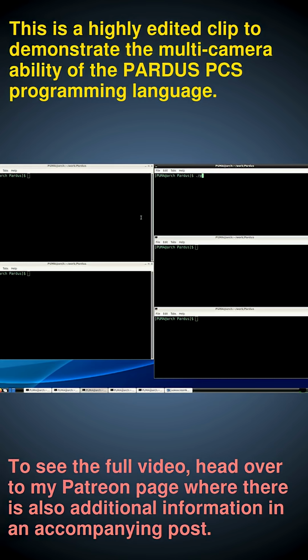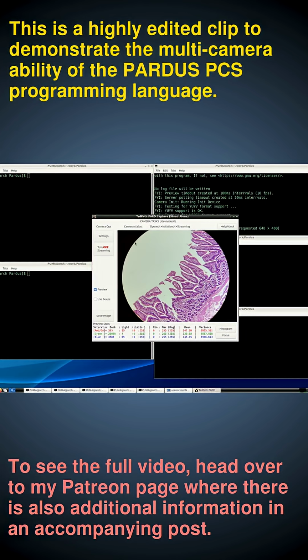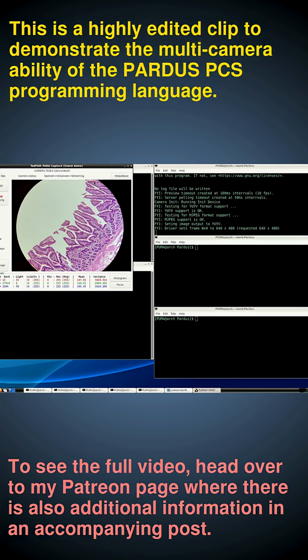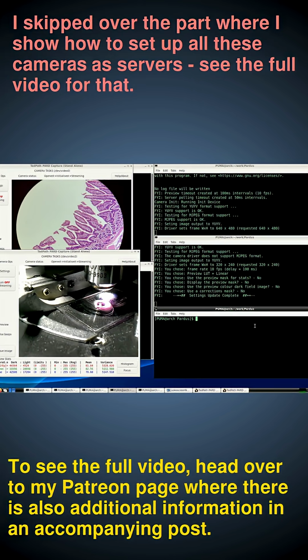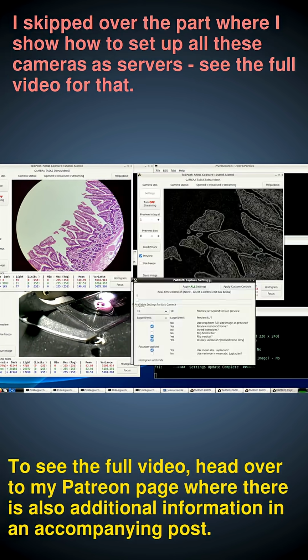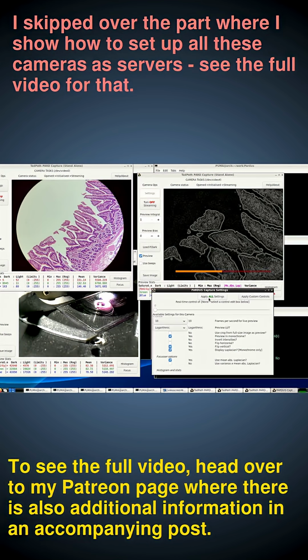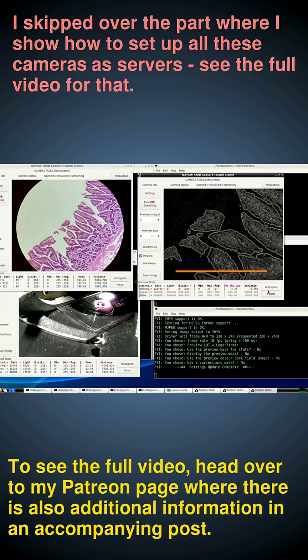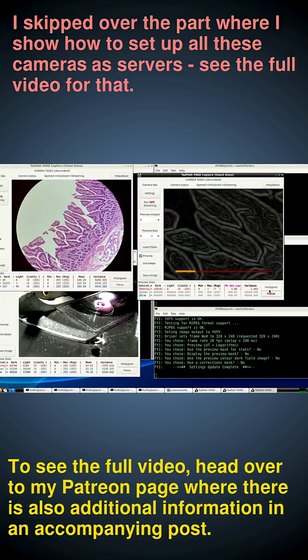So first, we'll start PARD Capture for the first camera. And if I put on the preview, there, it's the camera that's looking straight down the microscope. So that's the external camera looking at the slide and the objective. And then finally we'll do our third camera, which is our focusing camera. So we might as well put the focus bar on, since we're going to be using that for focusing. So if I move the slide, you can see they are both moving together.